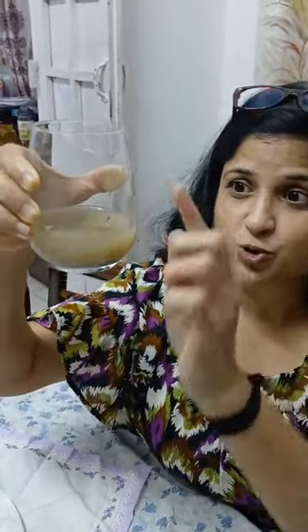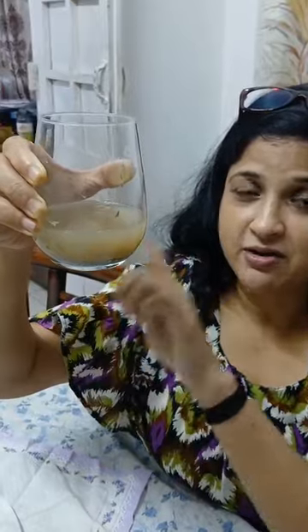The heavier particles are not only insoluble but also heavy, so they settle down. This layer of the settling down of the mud particles, the heavier particles, is called the sediment. And as you can see, the top layer has a little bit of mud particles. Since it is lighter in weight, a different layer is formed.